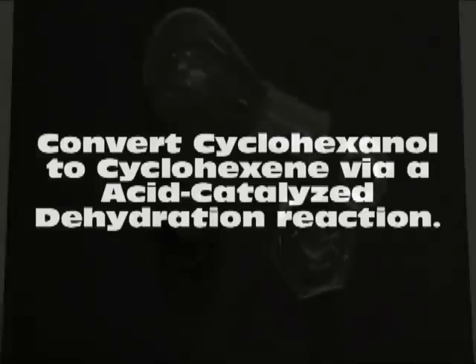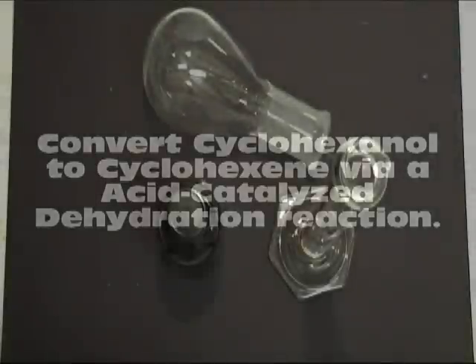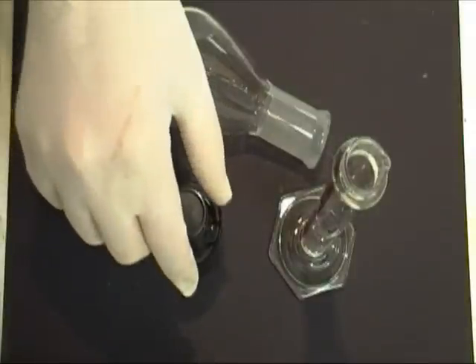Hello YouTube. It's time to do another organic reaction, and this time we'll be dehydrating cyclohexanol to cyclohexene via an acid catalyst. Let's get started.